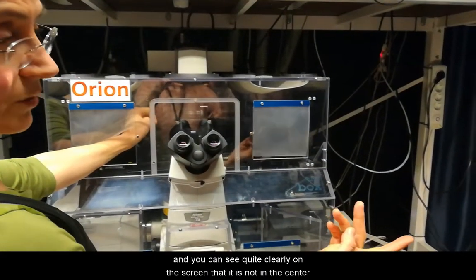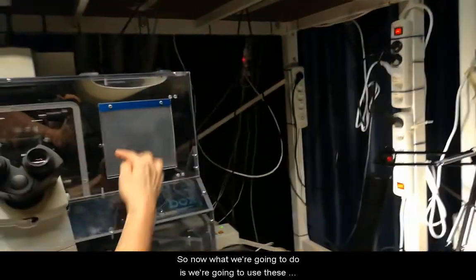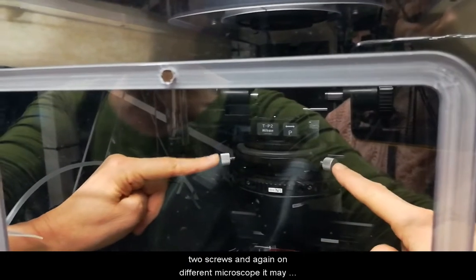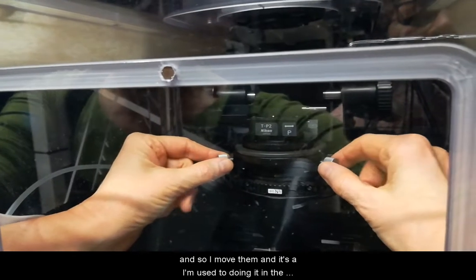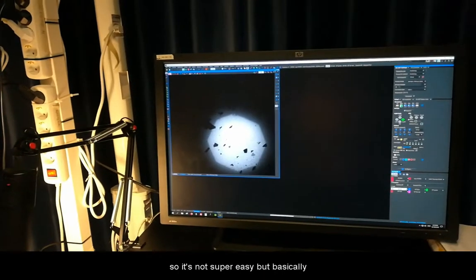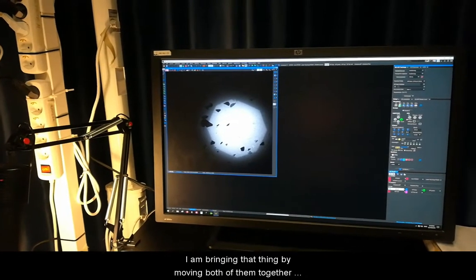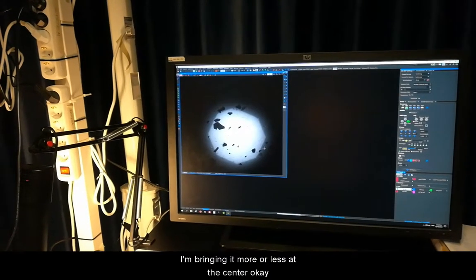You can see quite clearly on the screen that it is not centered. So now we're going to use these two screws. On different microscopes it may look different, but it's always two screws at a 90-degree angle. I move them — I'm used to doing this in the eyepiece and not so much for the camera, so it's not super easy — but I'm bringing it more or less to the center by moving both of them together.